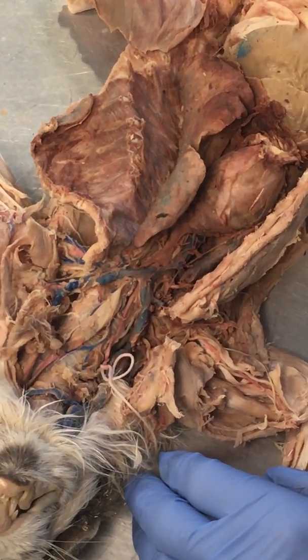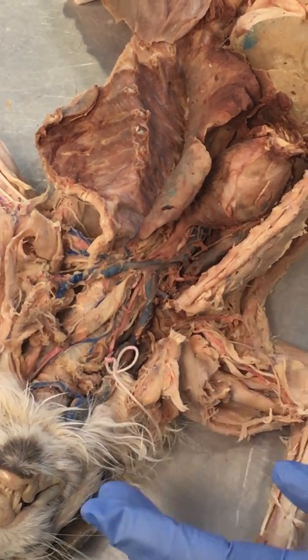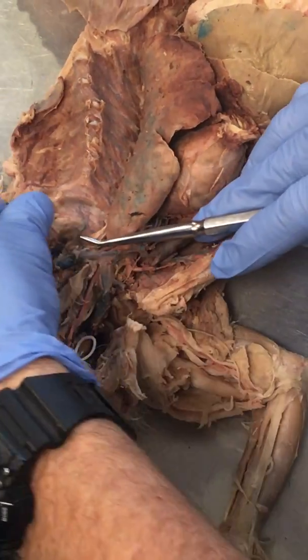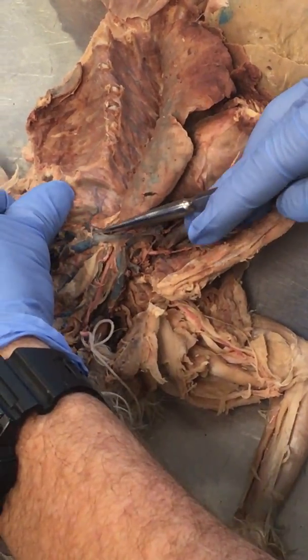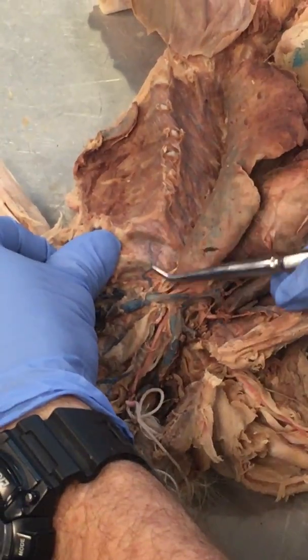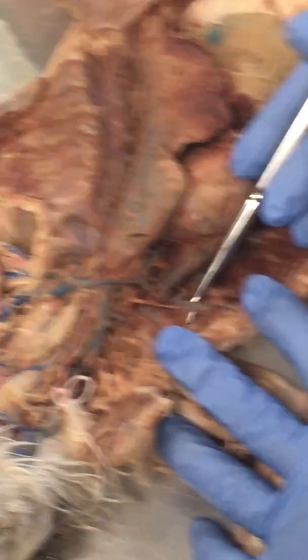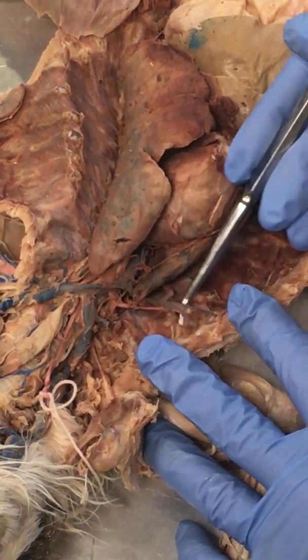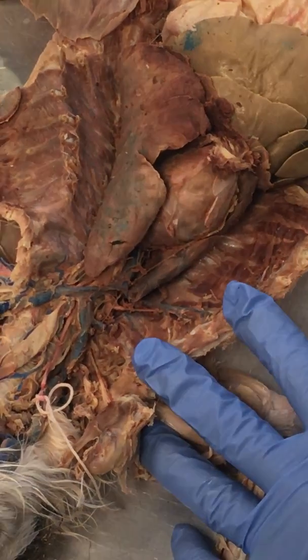Next thing, internal mammary. Same thing as internal thoracic in humans. This is a great shot of them. You can see, not so well on this side, but they're there. The artery and vein going along the inside of the thoracic cage there, but it's much more evident on this side. These would be your internal thoracic artery and vein, or internal mammary artery and vein, both sides.